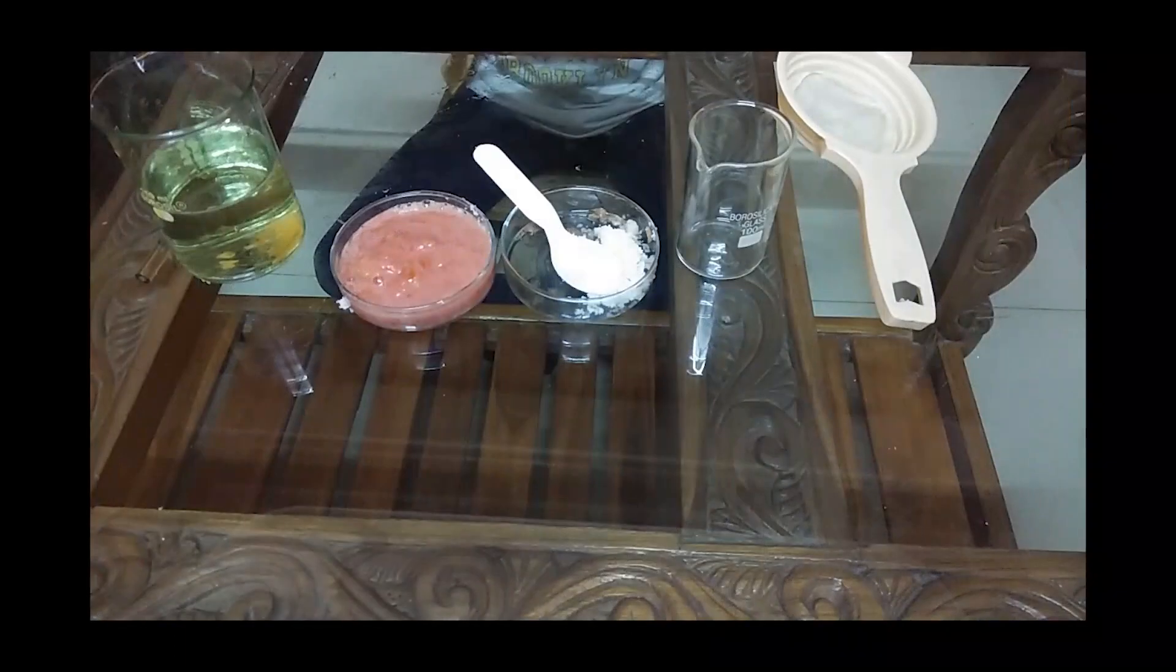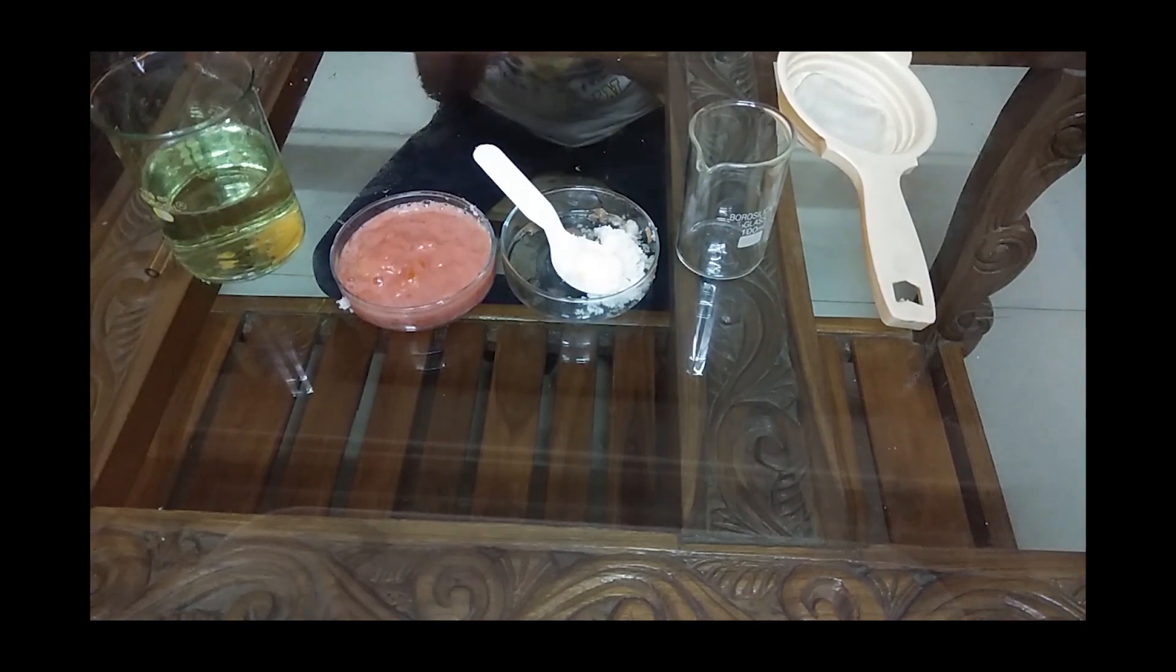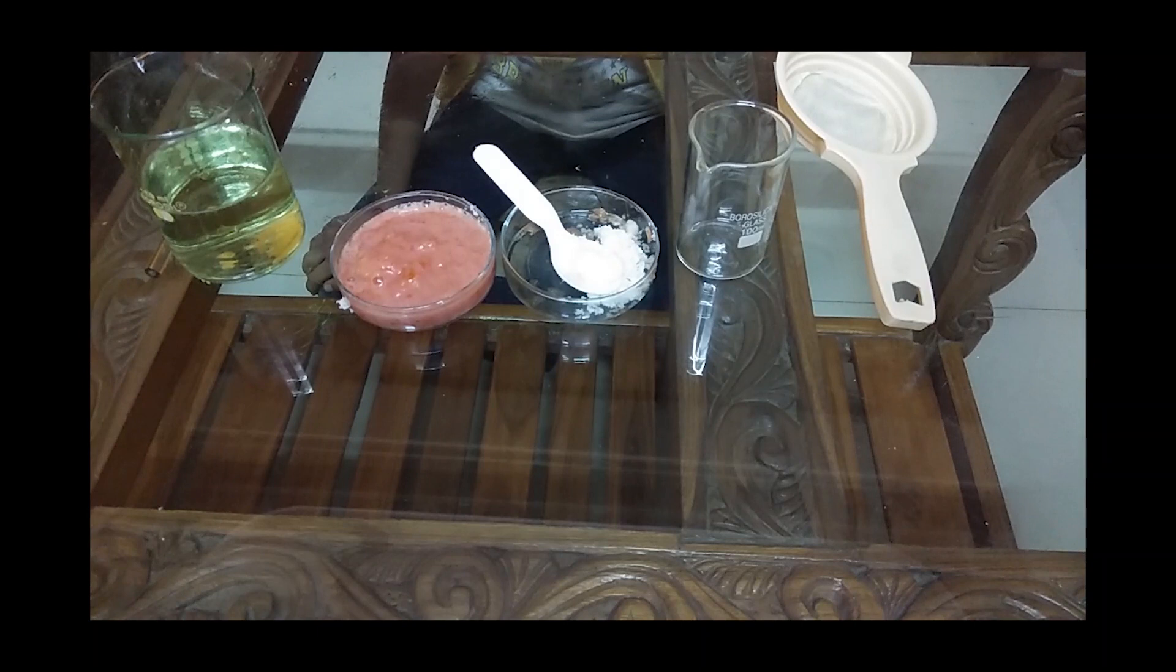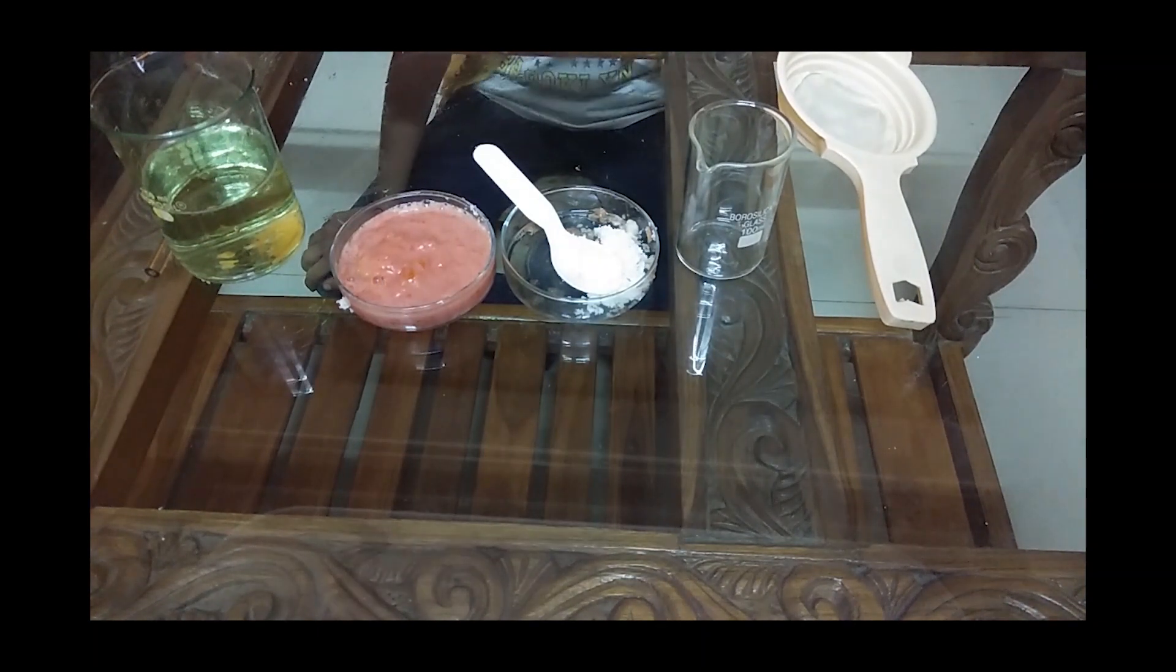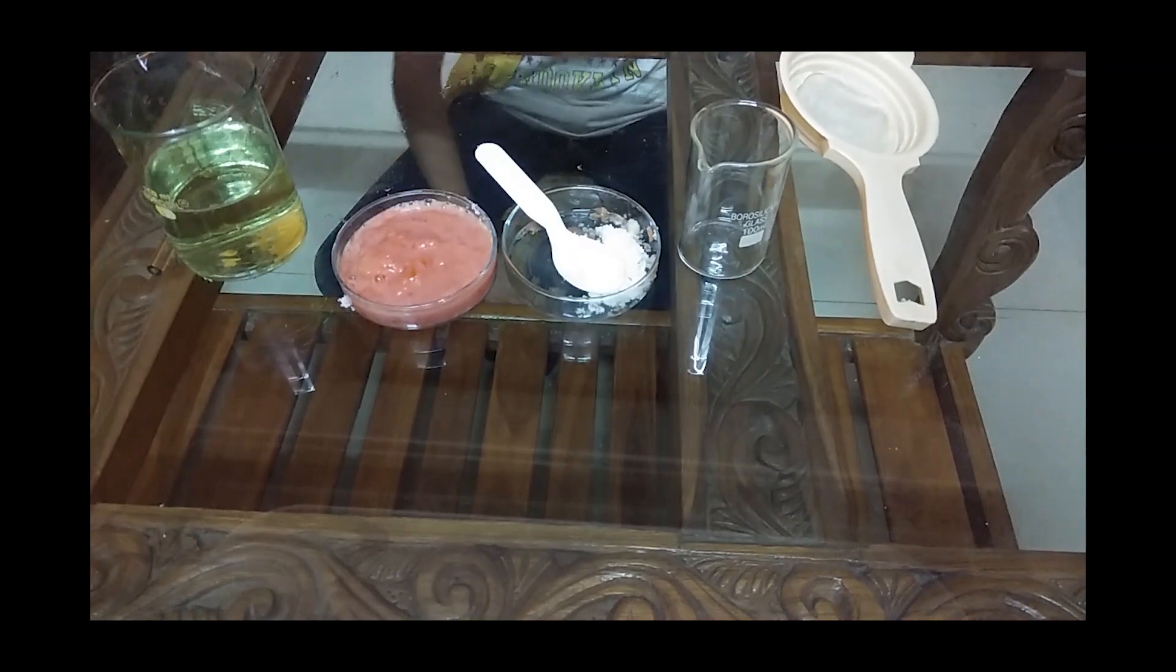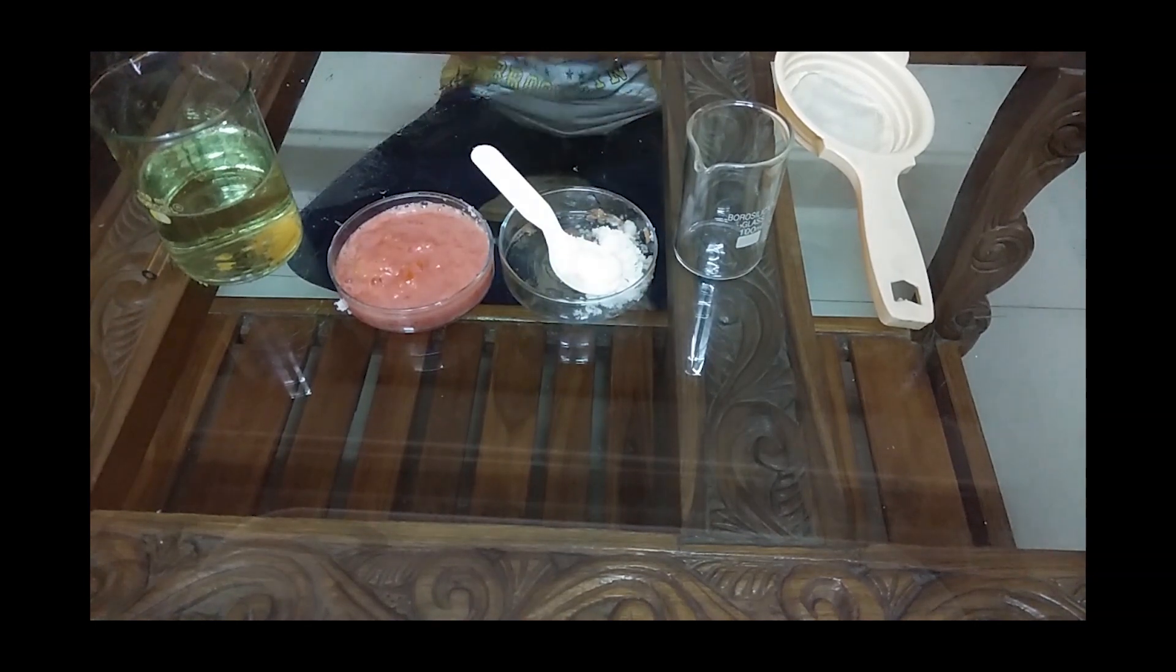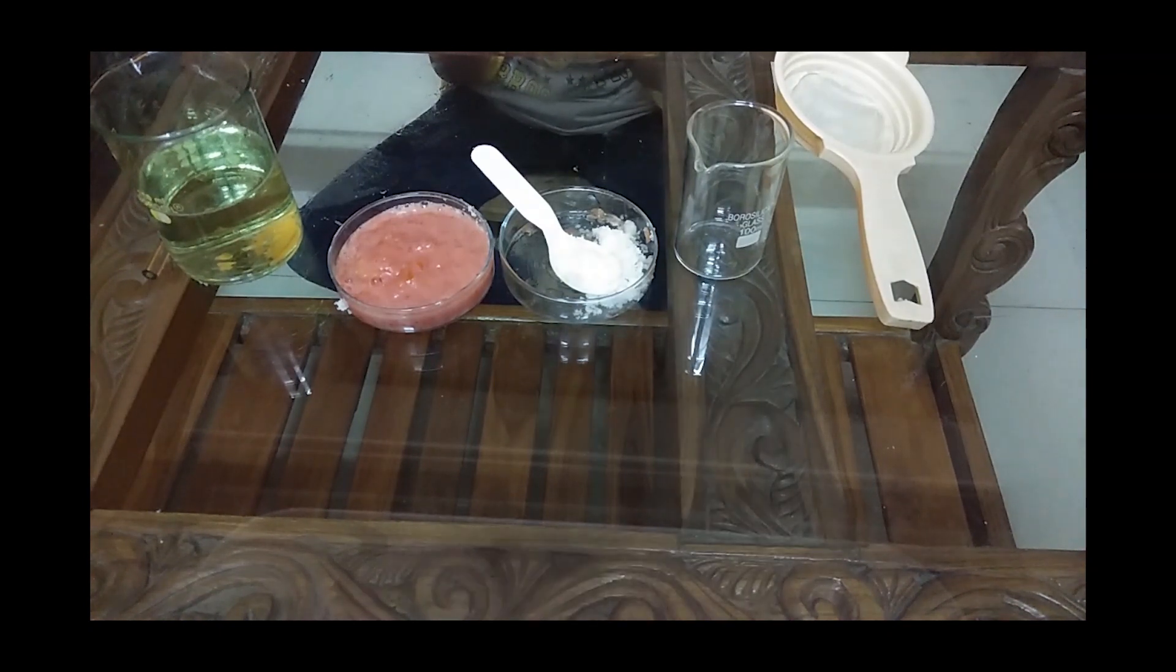Now students, I will tell you a short protocol of how to get this process done. Mind you, only a short protocol, not the exact protocol how we do in a research lab. When you do it in a research lab, you need a sterile environment. Here I am doing it at home during lockdown period. This is a child's play, I tell you. To prove that, I'm making my child do the process.